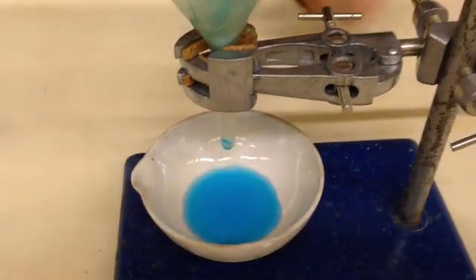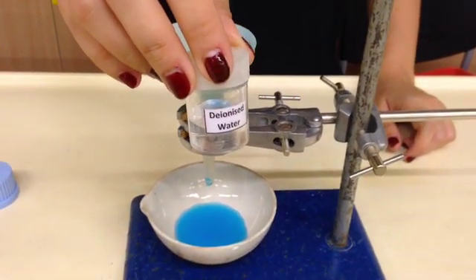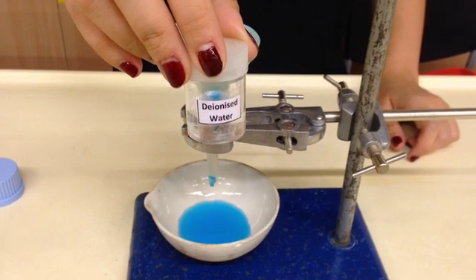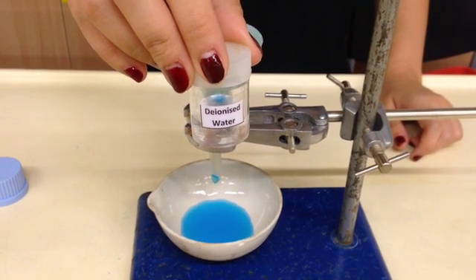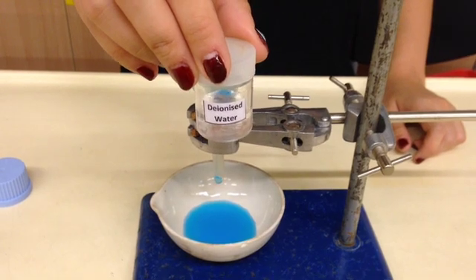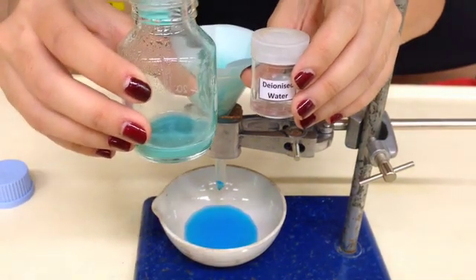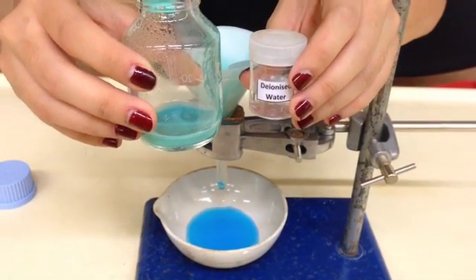So while you're waiting for it to finish filtering, we have here deionized water. Deionized water is actually the same as distilled water, it's just pure water. So with this pure water that you are given here, we are going to wash whatever is left inside the original beaker.